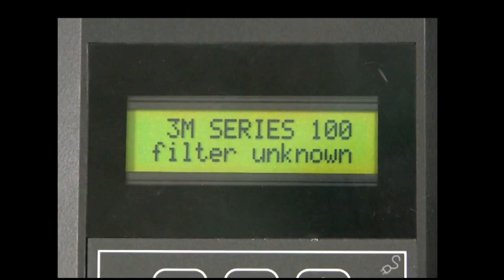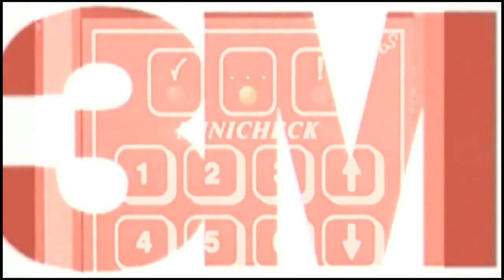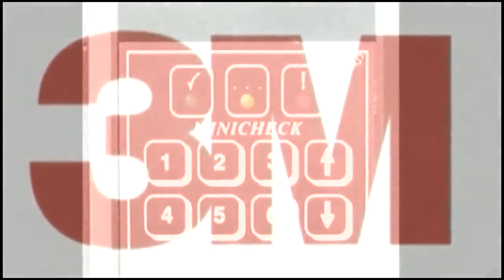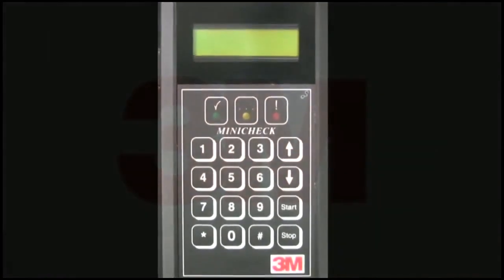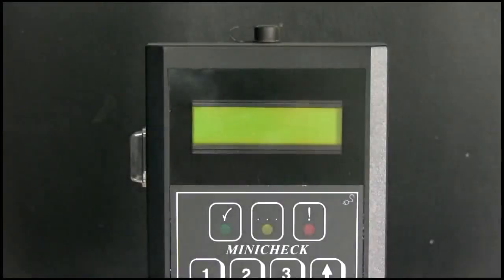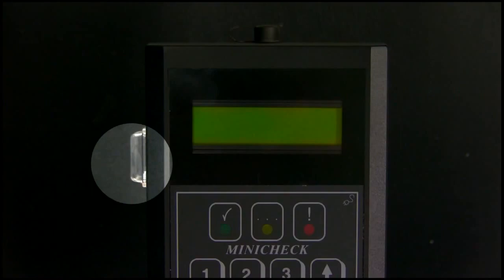The service menu on the device allows the user to edit a number of parameters that will change infrequently. The most common include the date, time, language, and units of pressure displayed. In addition to these parameters, there are also settings in the service menu that should be accessed if technical issues arise. To access the service menu, first activate the device by pressing the On button.